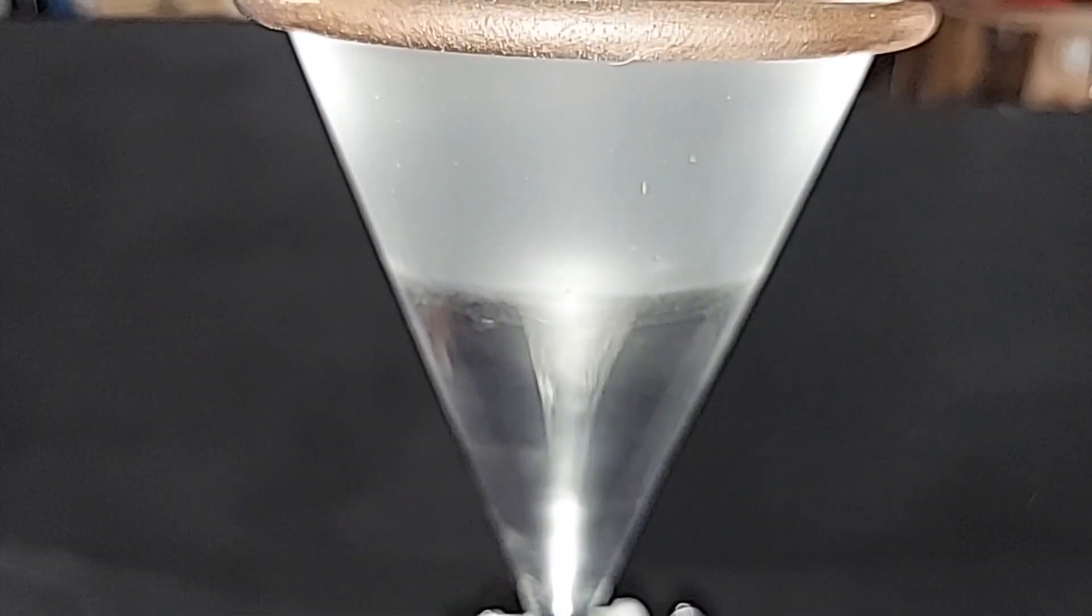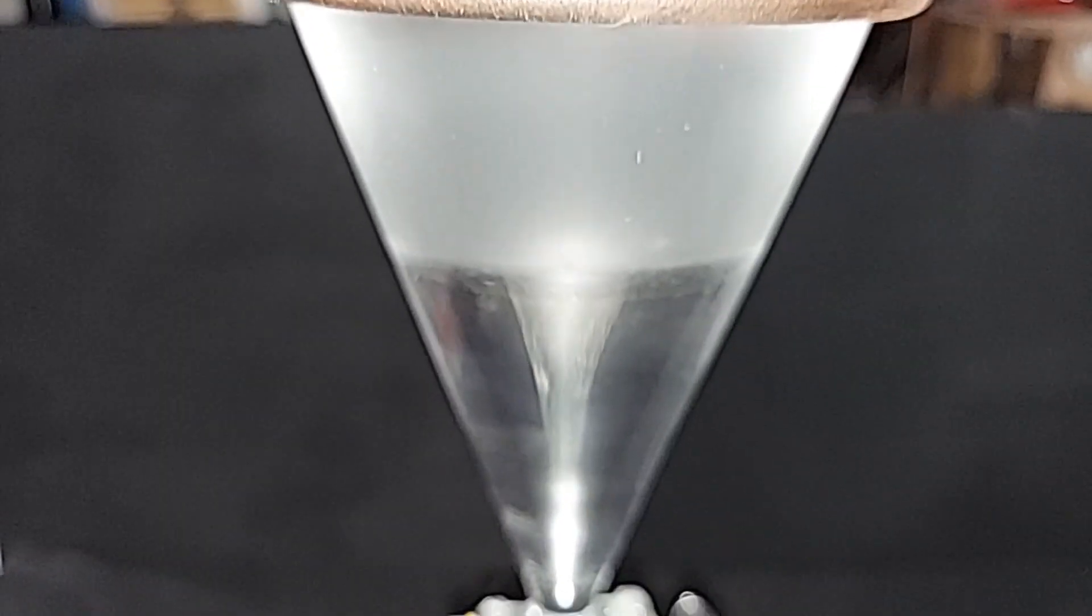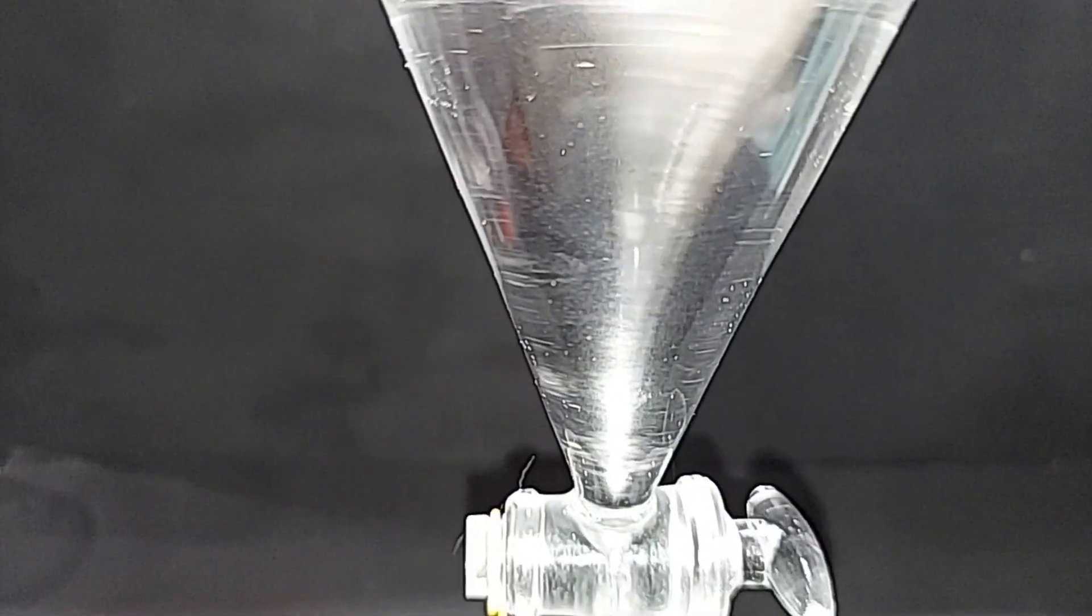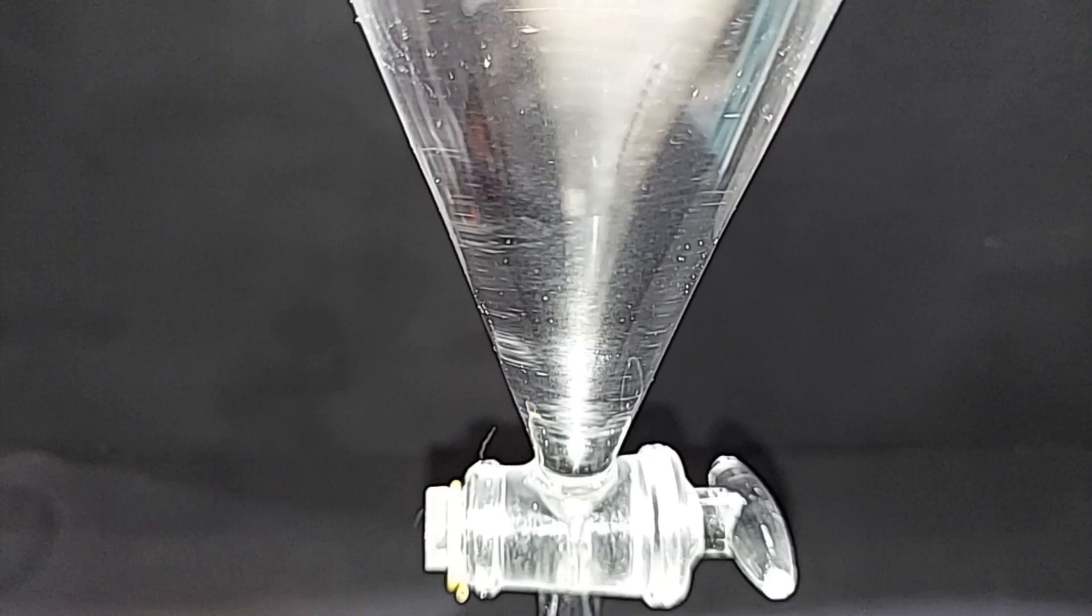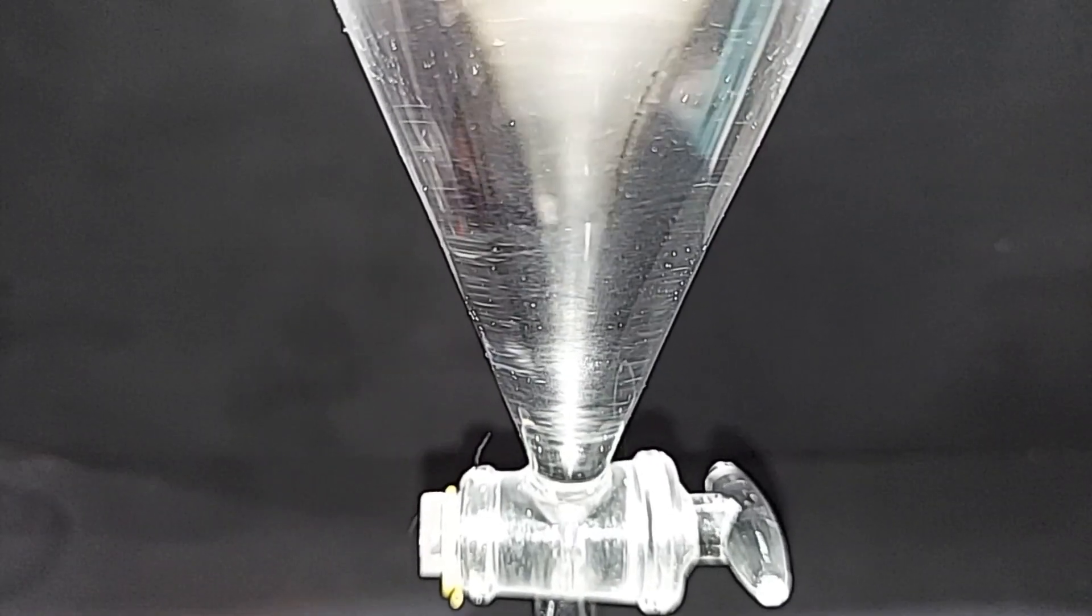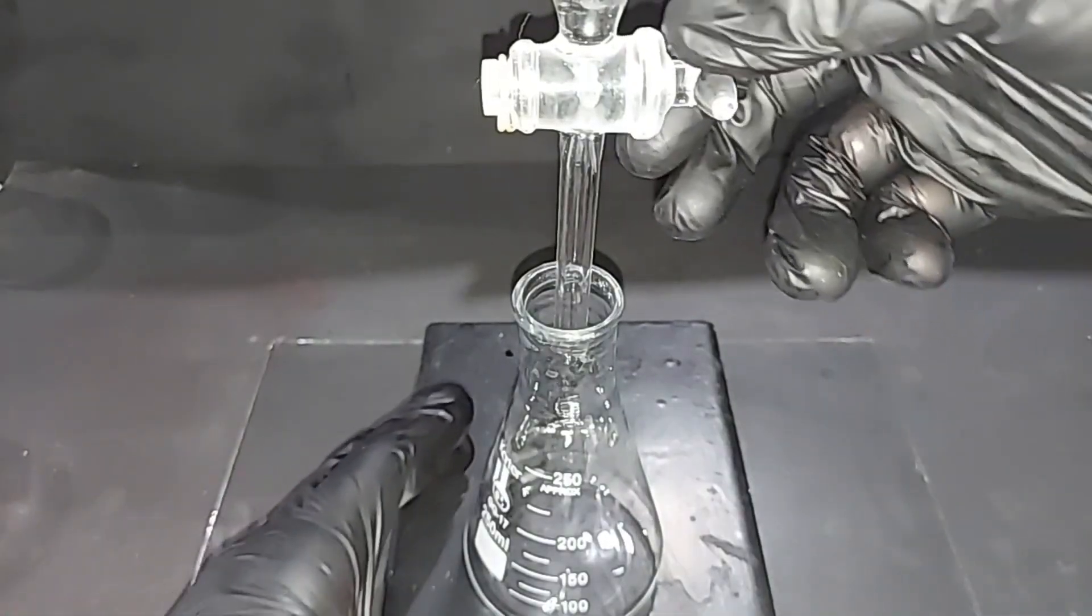You can clearly see that the salt has done its job. It's absorbed water and other impurities, other salts of course, and it's clouded up nicely. Down here is our even purer chloroform, but it's not quite pure as we can get it. It still needs to be distilled. Once again, just collecting the chloroform.